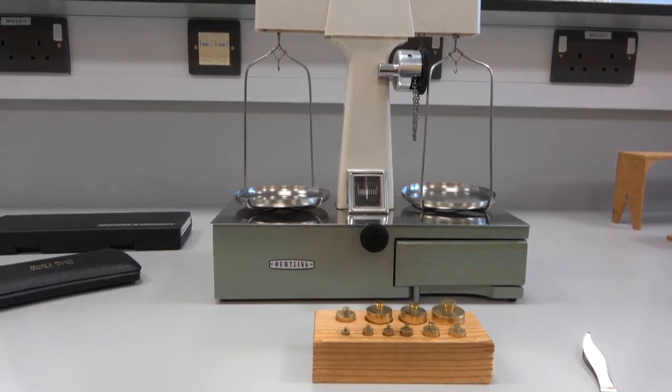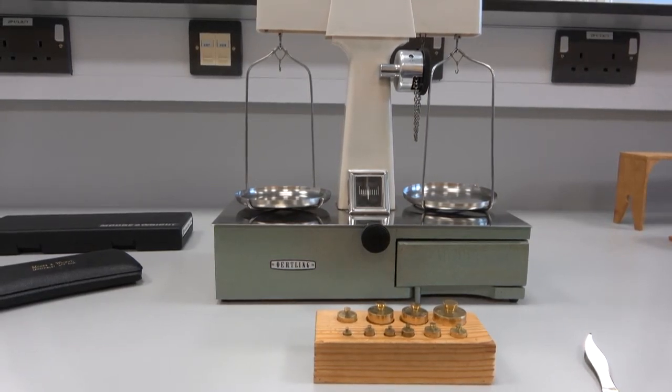So this is our mass balance. Quite an old-fashioned instrument, obviously, but there's a good reason to use one.